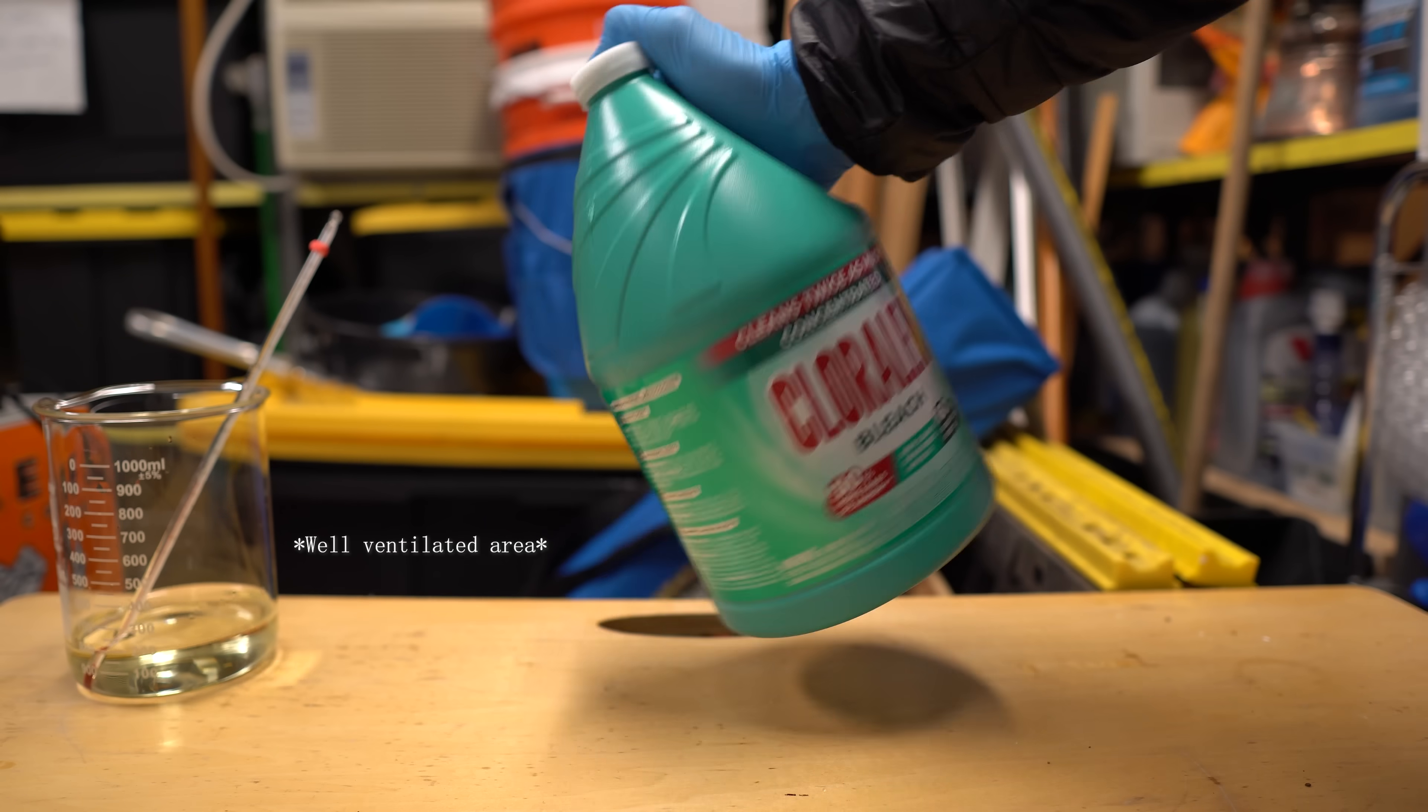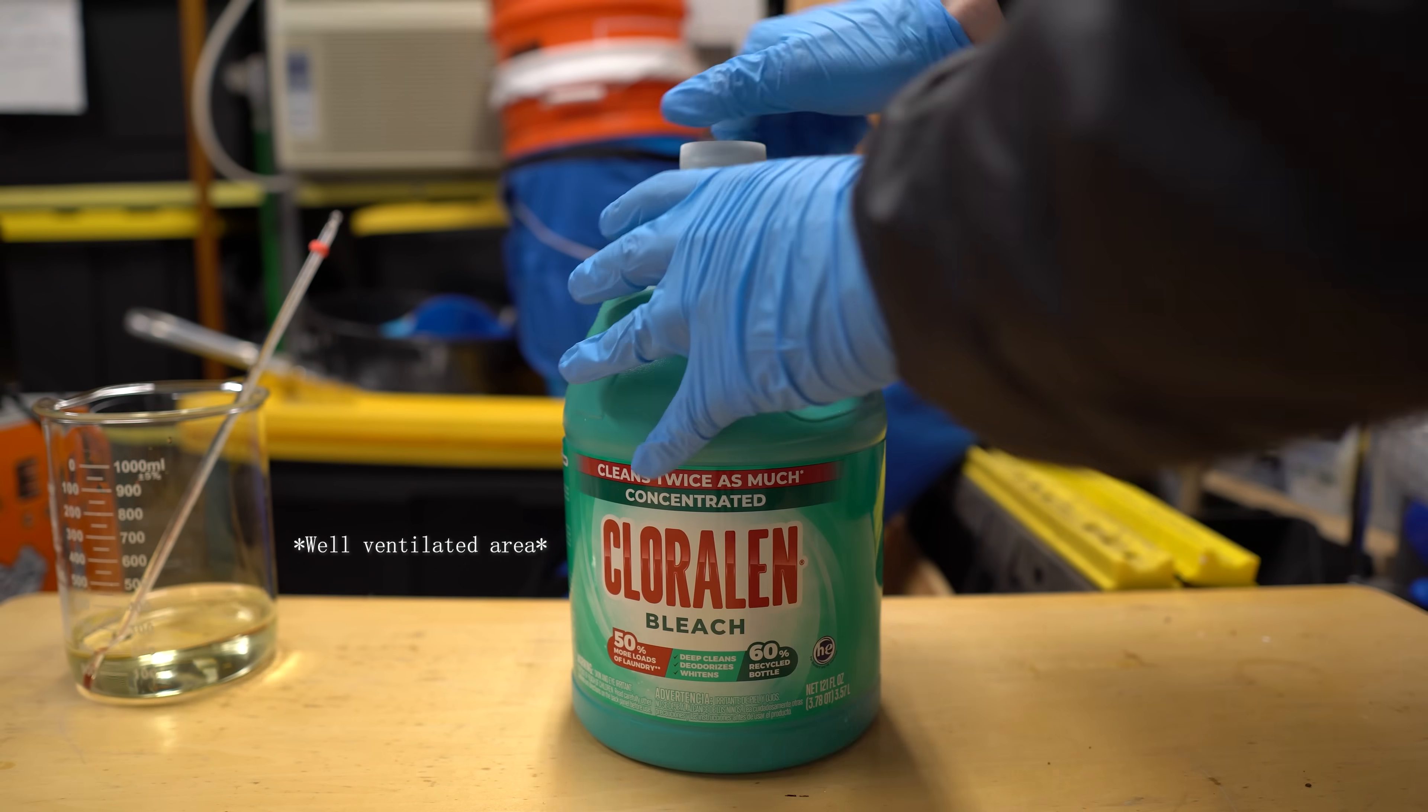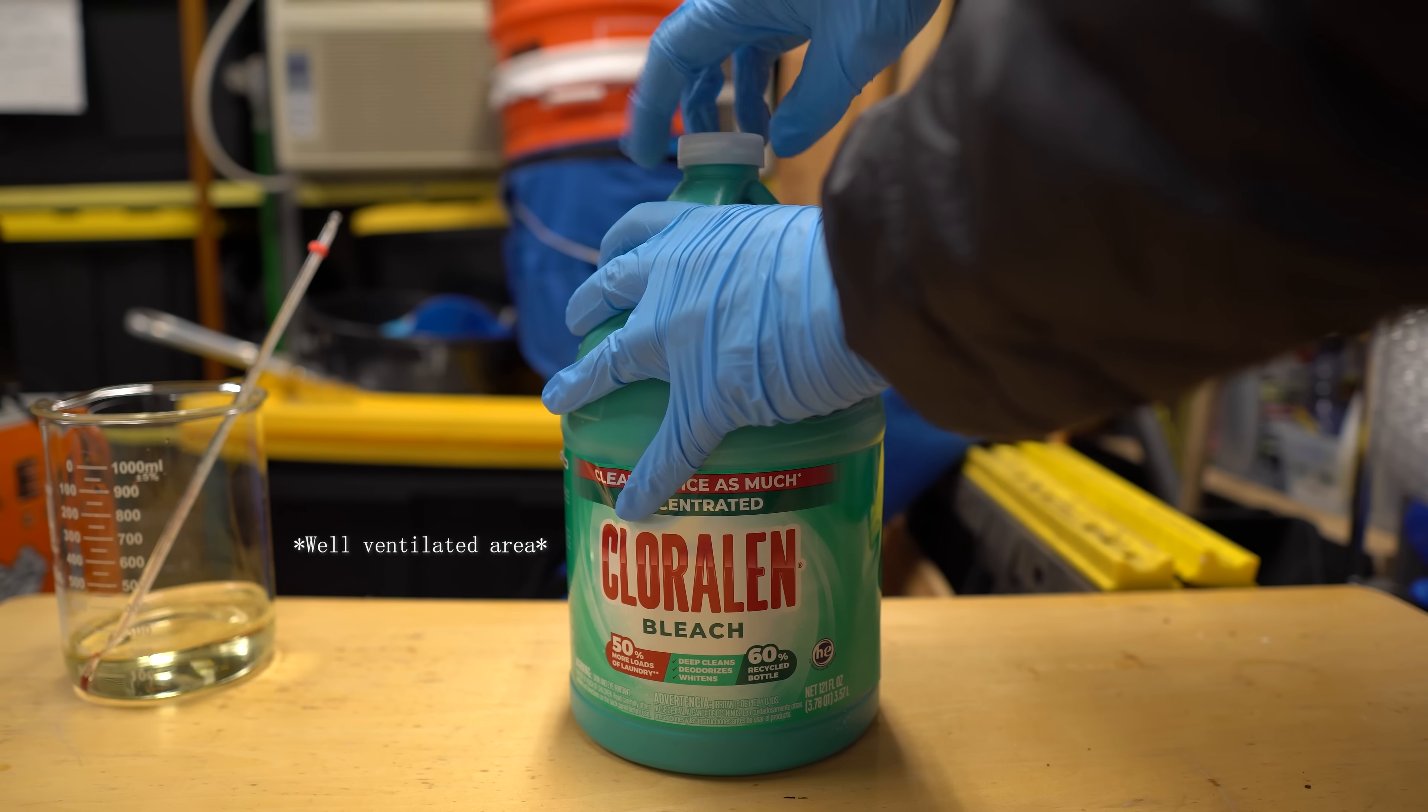Once you're done shaking, make sure to leave the cap loose to allow any gases to leave the container. You do not want an exploding bottle. Now, let's go over the mechanism of this reaction.